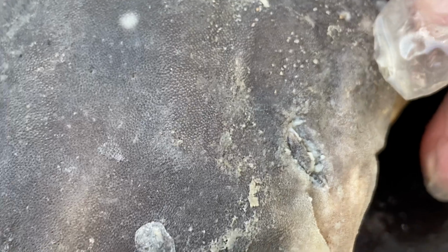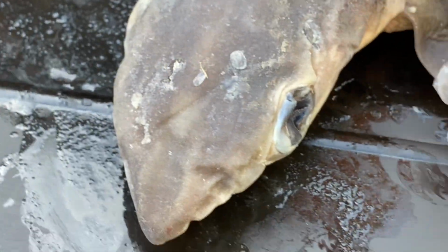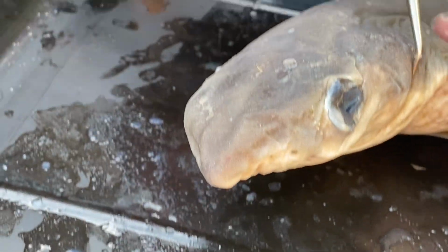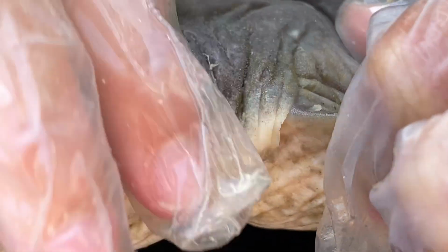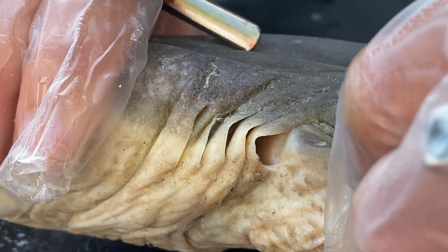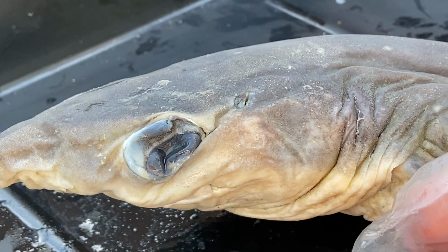So most sharks have to swim with their mouths open. That's something called ram ventilation. In ram ventilation, literally the water is ramming its way into the mouth and coming out the gill slits. Here are your 5 gill slits right here. They're kind of just bunched a little bit. So almost all sharks have to swim with their mouths open, or they have to swim or else they will not get their oxygen.